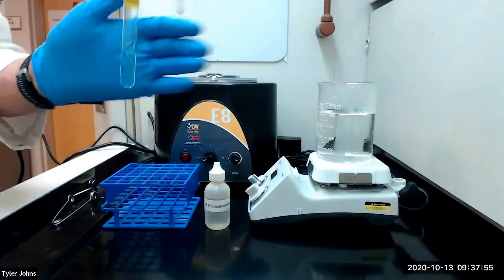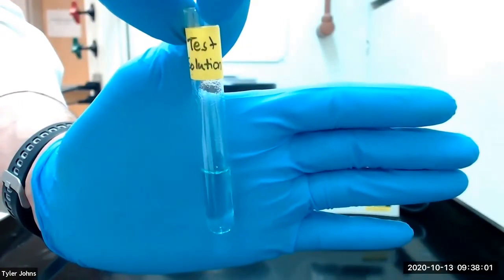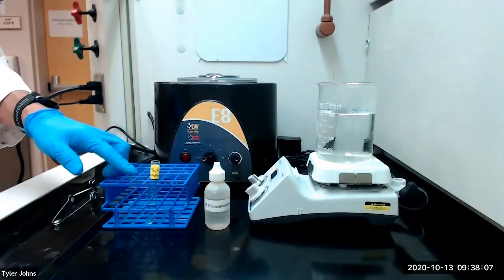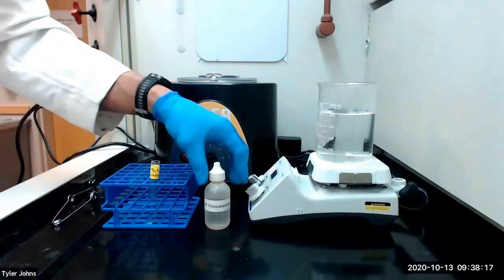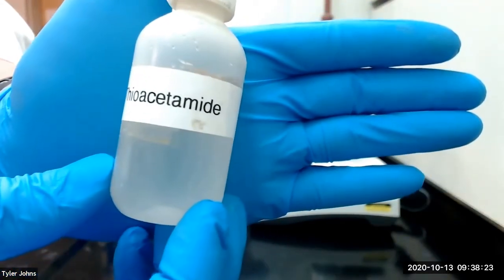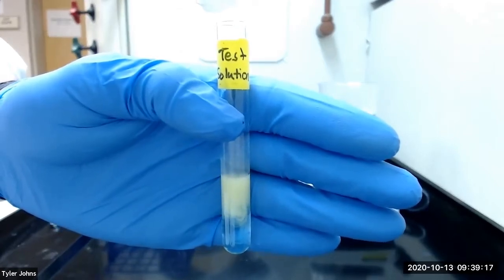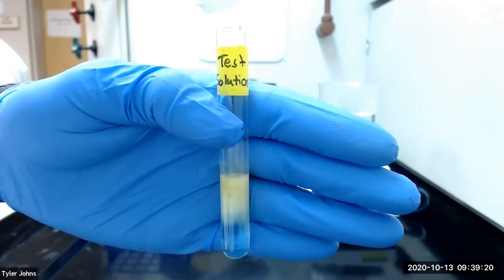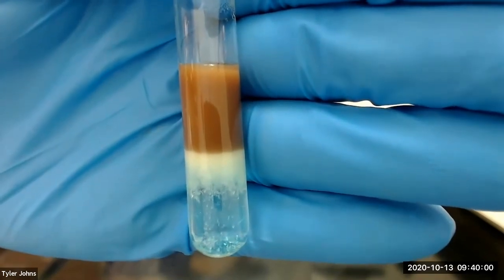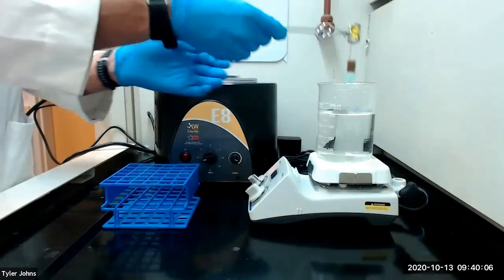We will begin this procedure with a test solution containing our lead, copper 2, bismuth, and tin ions. We can also begin with our S1 solution from the chloride group or group 1. We're going to add 10 to 12 drops of 1 molar thioacetamide to our test solution. We will then place our test solution in a hot water bath for 10 minutes.